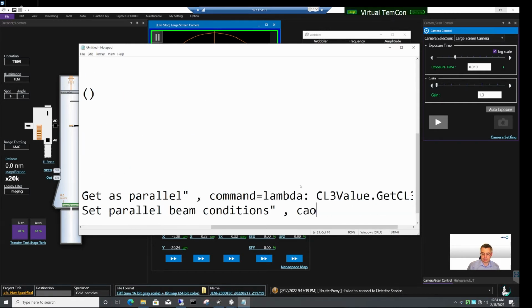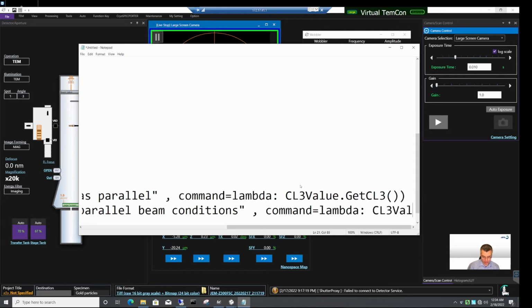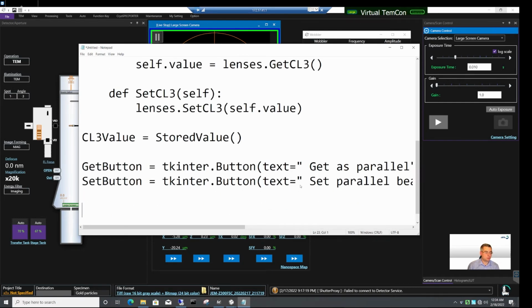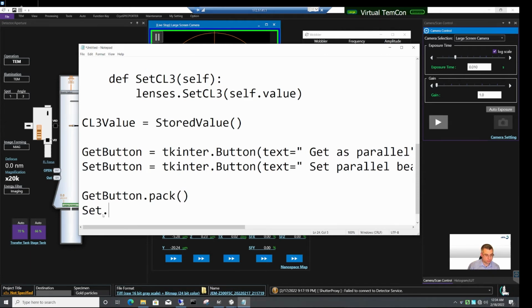And in this case the command will be again lambda, and this is CL3 value set CL3. Okay, so we've got the container, we've got the buttons, then what else do we need to do? Probably we need to pack these buttons in a window and set button pack. All these commands do is they make sure that our get button and set button are properly displayed in a window.